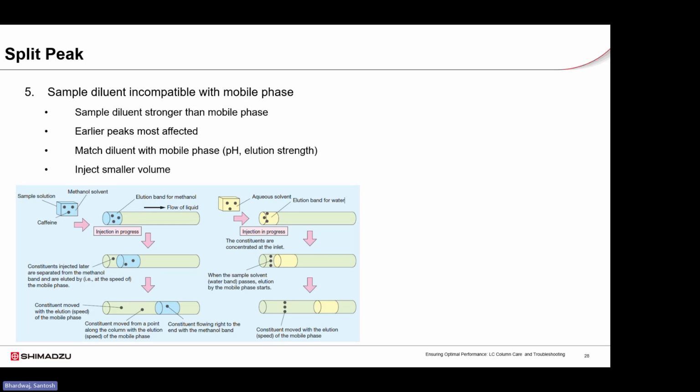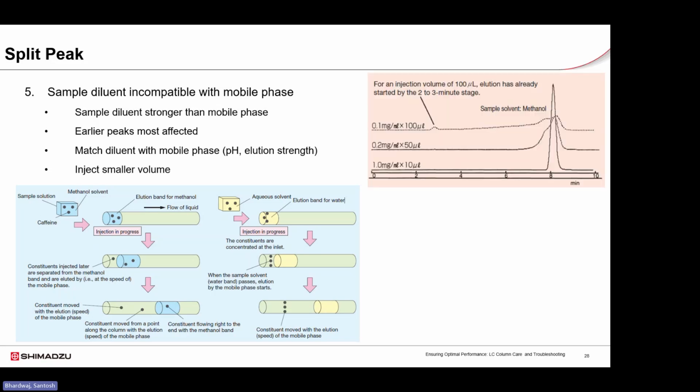If the diluent is stronger than the mobile phase, especially for early eluting compounds, poor focusing can occur at the column inlet, leading to distorted or split peaks. To prevent this, always match the diluent strength and pH as closely as possible to the mobile phase and consider reducing the injection volume.